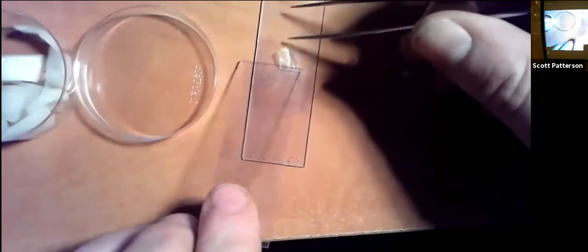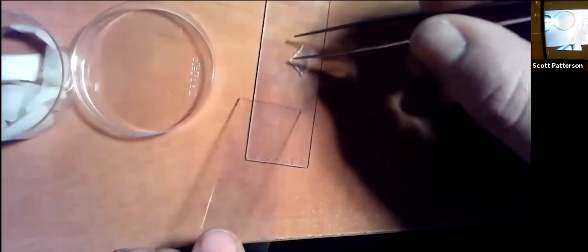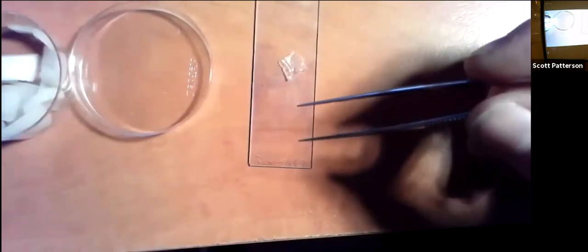But folded up is not the end of the world. What you can actually do, use the forceps, grab a slide to hold it down and just very carefully unfold it. You see what I'm saying? Now it's gonna be kind of annoyingly sticking to things, but just be patient, precision tools.